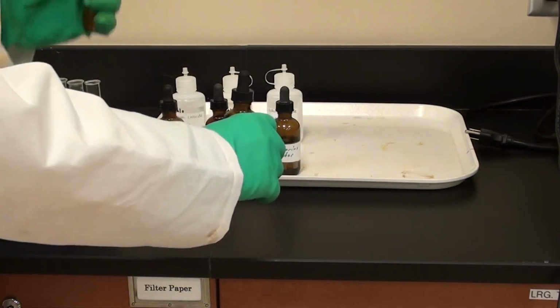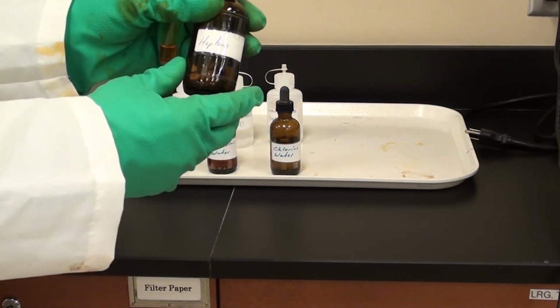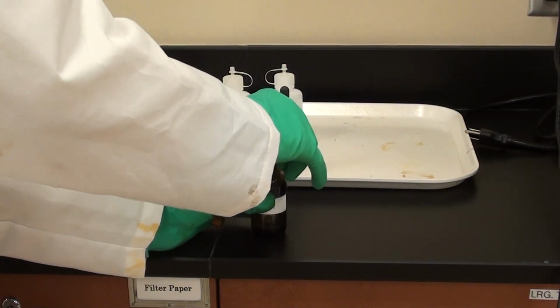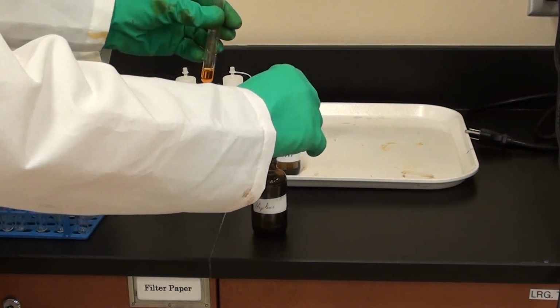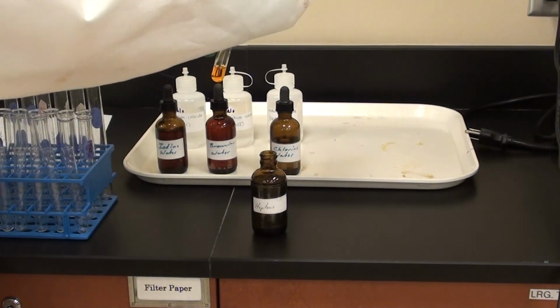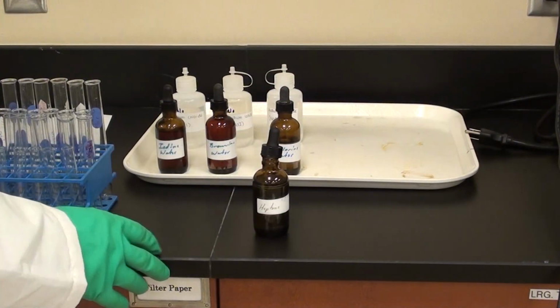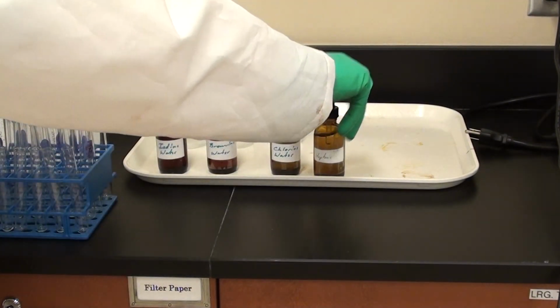All right, here's my hexane. This one happens to be labeled as heptane, but it doesn't make any difference. It could be heptane, could be hexane, could be cyclohexane in some places. In any case, it's just an organic hydrocarbon that's going to be used to show the coloring here. Now this is always going to be on the top layer. Go ahead and add that. How much are you going to add? About 2 squirts again? One squirt actually seems to be reasonable. Fair enough. So let's bring that over here now.